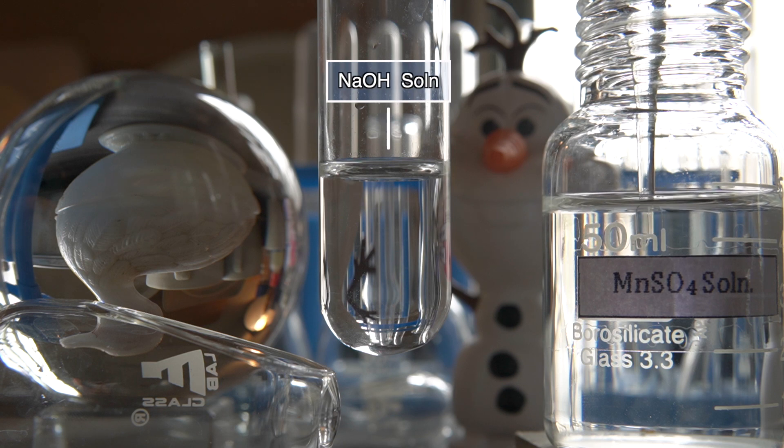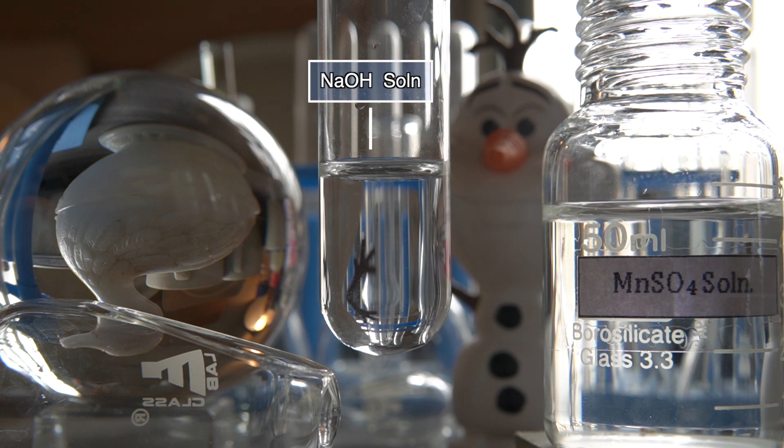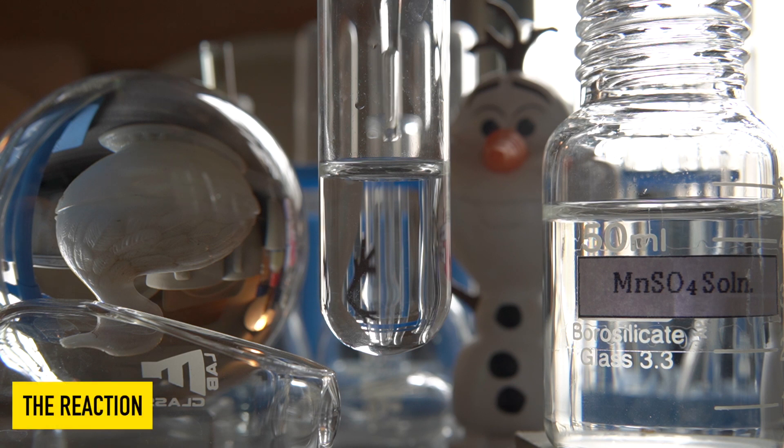We will add a clear solution of MnSO4 into the NaOH solution and observe the effects.